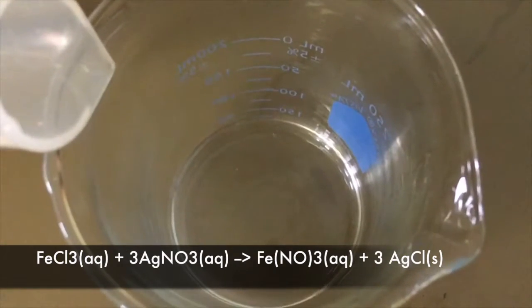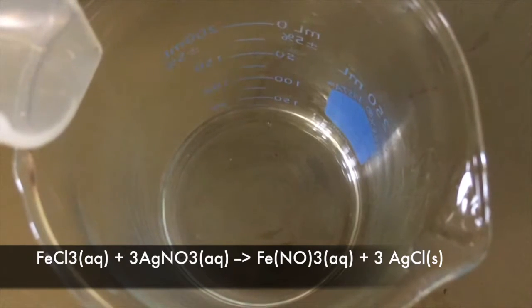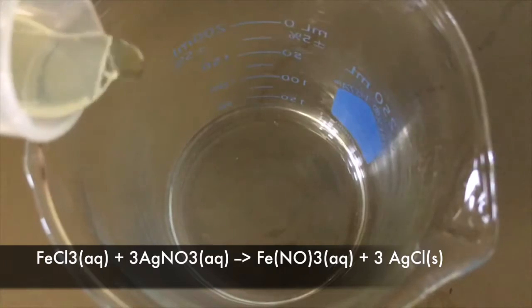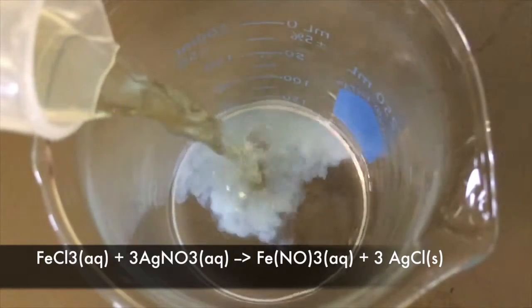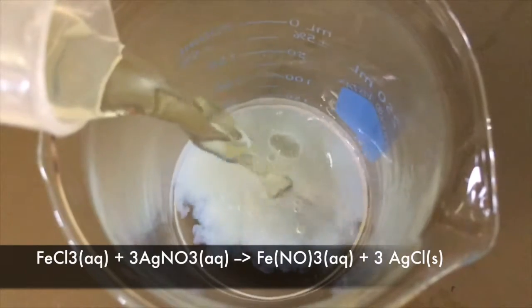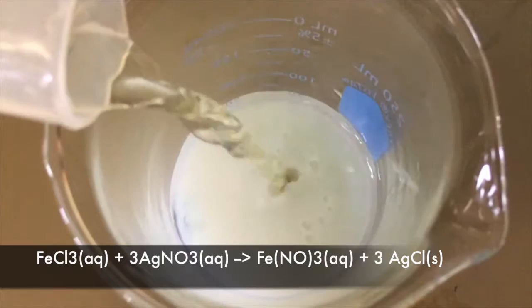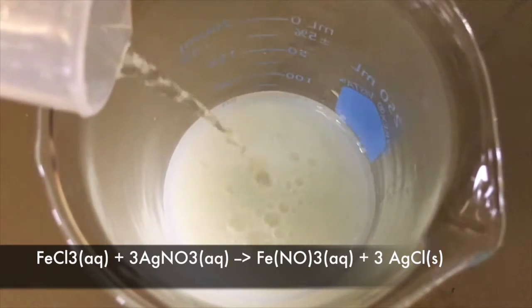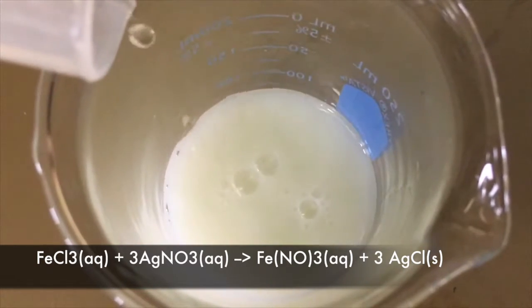When we add iron 3 chloride, a double displacement reaction takes place. Out of these 4 compounds that are in the reaction, 3 stay aqueous and soluble in water. Silver chloride, however, is an insoluble opaque white solid, which creates the white color in the beaker that we see here. Silver chloride is an ionic solid. It does not dissolve in water. The ionic bond and its forces holding the solid silver chloride together and its lattice energy are too strong to be overcome by the forces that would favor the formation of a hydrated ion.